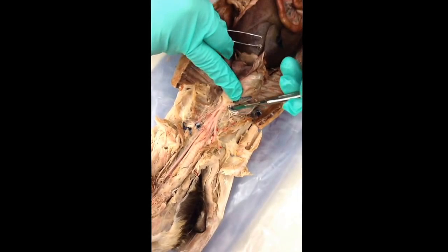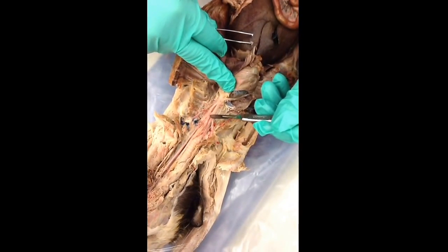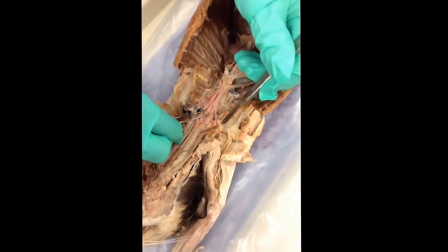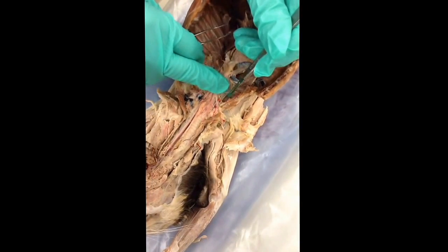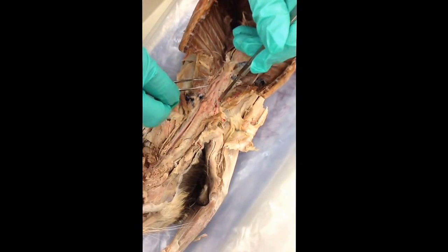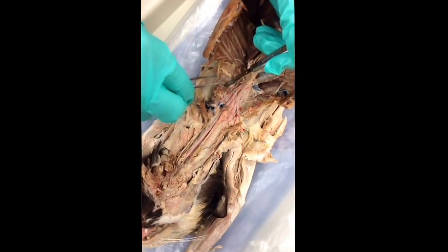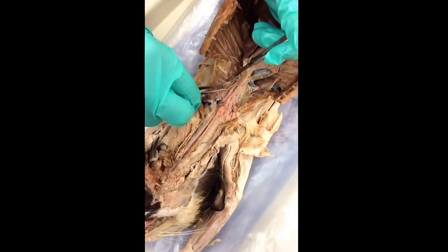All right, so if we come back up here, let's come back up to the brachiocephalic. It comes up, and there is a left common carotid, a right common carotid, and a right subclavian. Now, the trick is, on the subclavian, we like to see branching off of there the internal mammary. The internal mammary is broken on this cat on that side, but here it is on the left side. There's the internal mammary. It's still not the best, but it comes up like so.